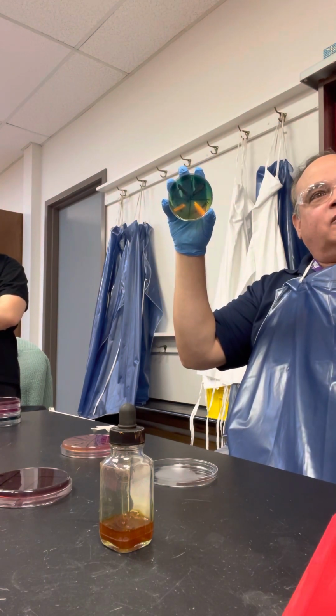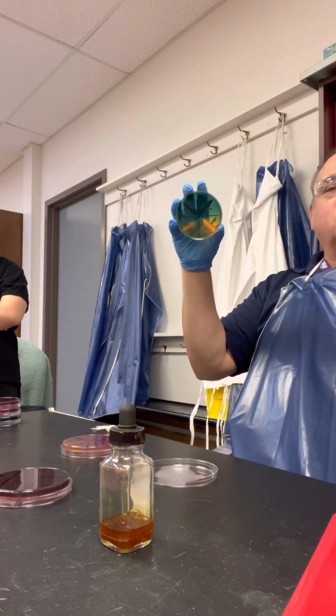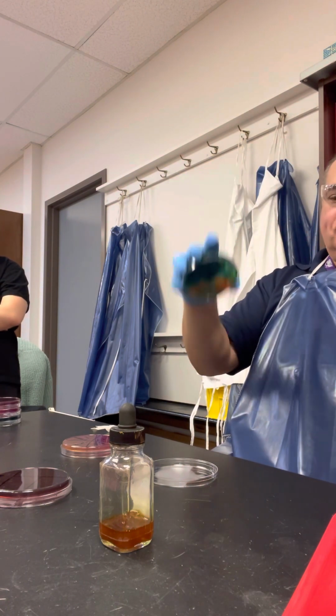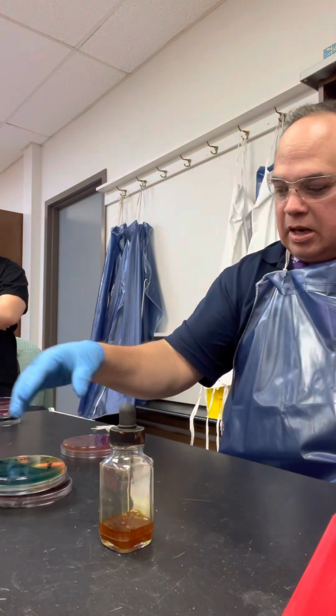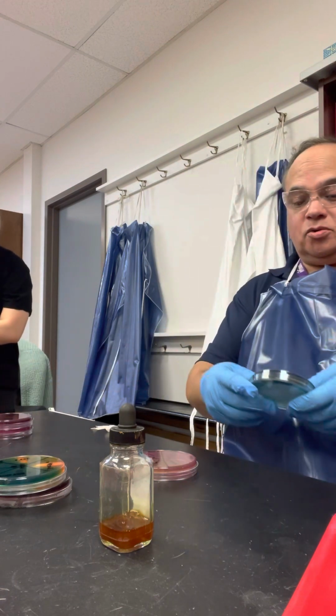If it's a lactose negative organism, we worry. If it's a lactose negative organism and hydrogen sulfide positive, then we also worry. Okay? Good? Last one.